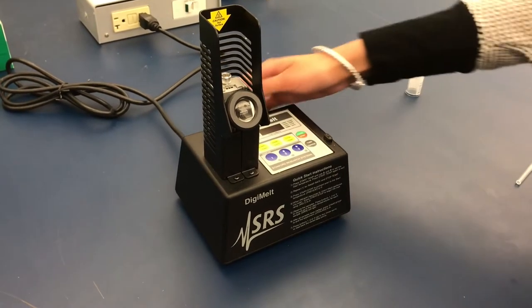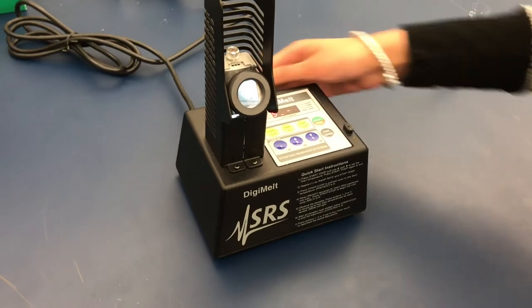Next you will need to prepare the DigiMelt. Begin by turning on the DigiMelt.